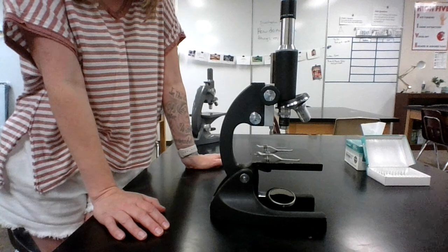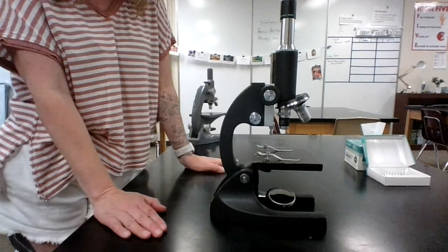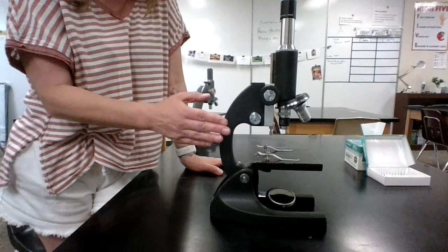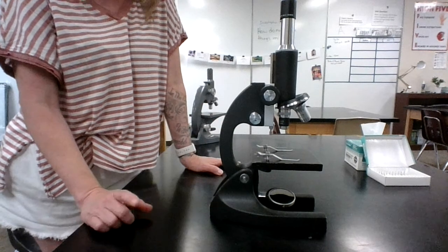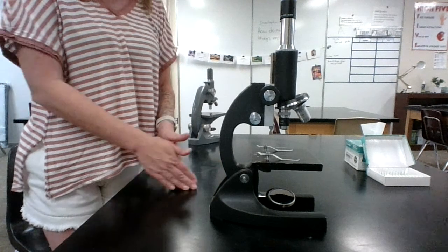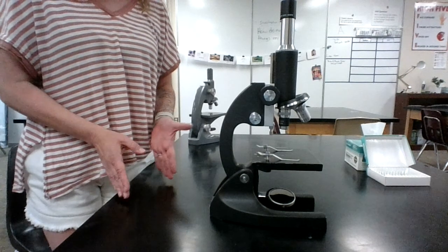Hi, we are getting ready to use microscopes in class, so we want to make sure you're ready to have a great experience and know how to use a microscope. Today, I'm going to show you the basic parts of the microscope and then basic steps of looking at a slide. It's important, though, when you're in class that you listen to your teacher's instructions and you read written information, because sometimes we may ask you to do something just a little differently.